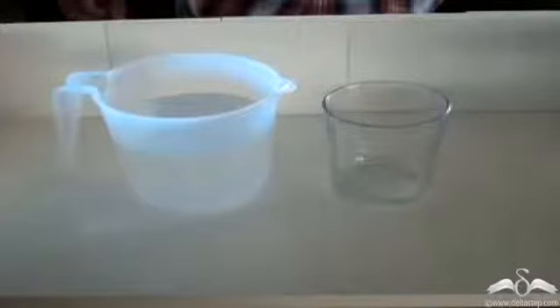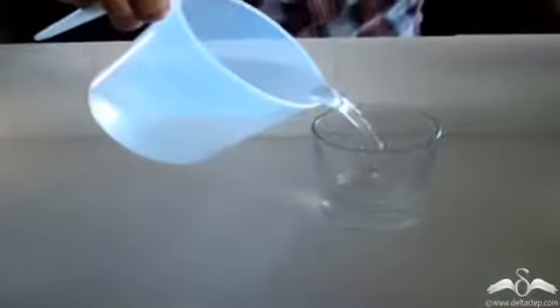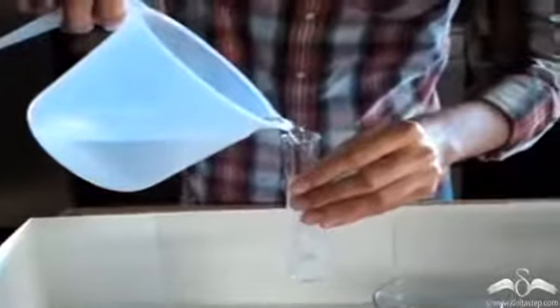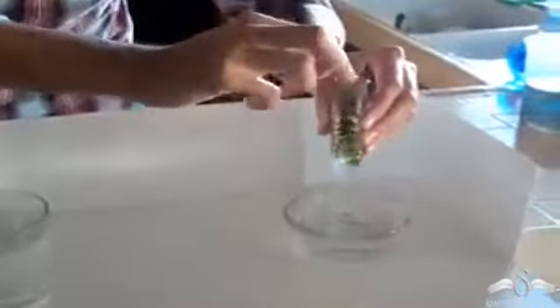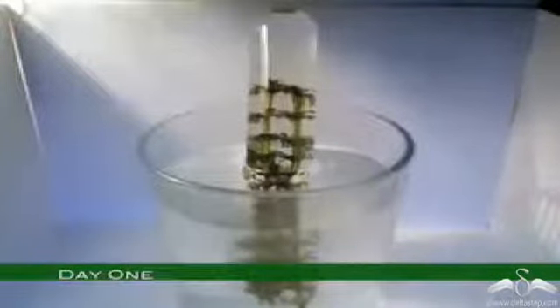Now let us perform a simple experiment to see if oxygen is liberated as a byproduct during photosynthesis. For that, take some water in a glass and take a test tube and fill it with water completely till the mouth. Insert some water plants inside the test tube and carefully insert the inverted test tube into the water glass and put a light source so that the green plant can photosynthesize. This setup is kept for 3 days.